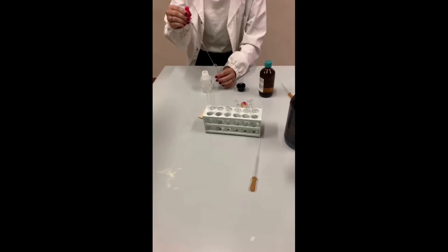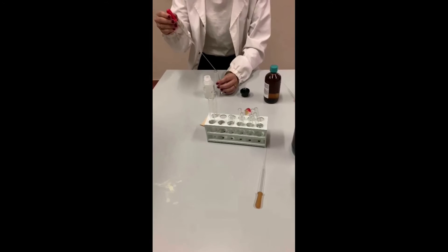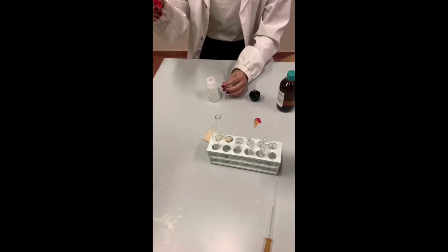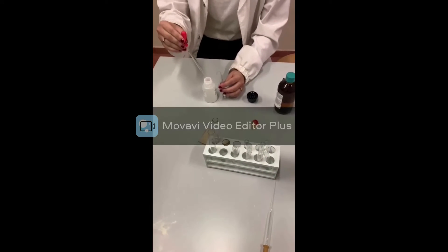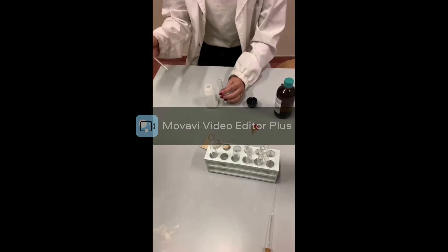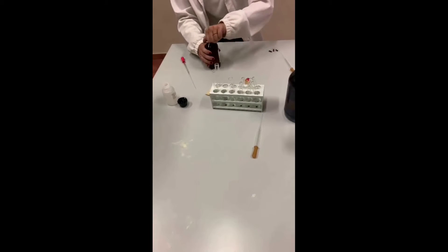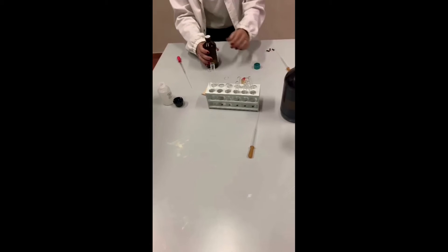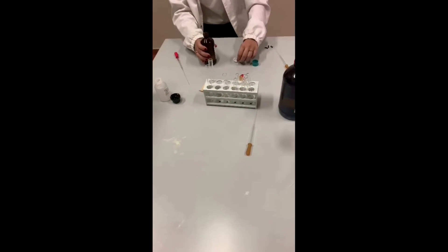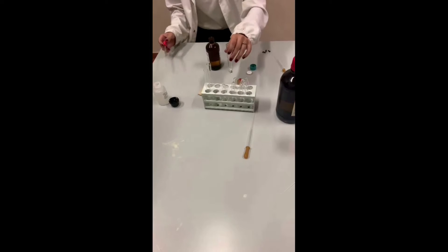We take three octanol pipettes and put them in a test tube — two and three. Then a pipette of butyric acid and add it to the octanol.